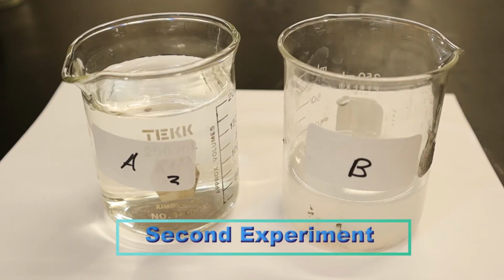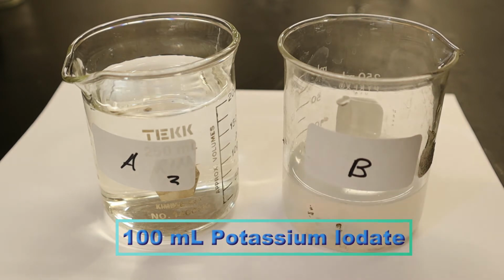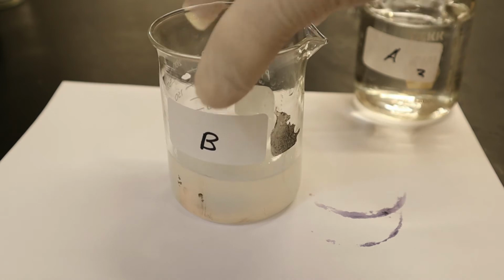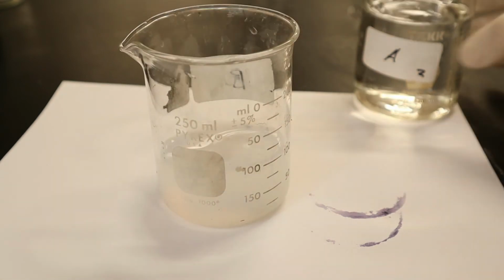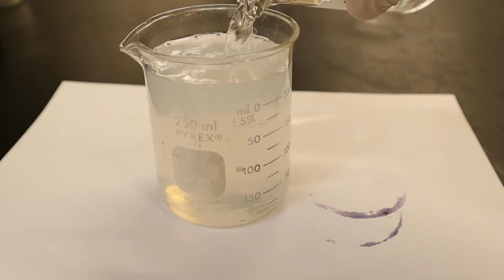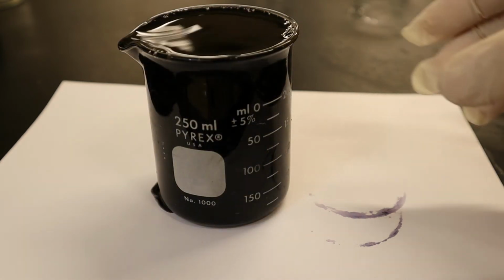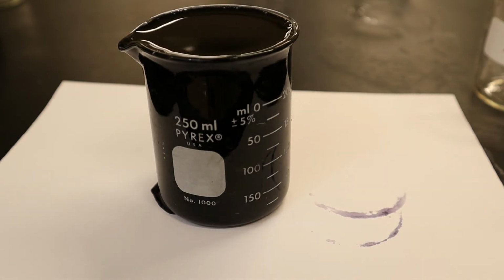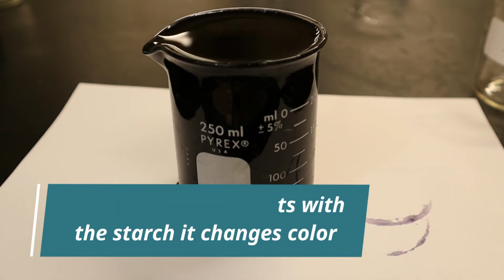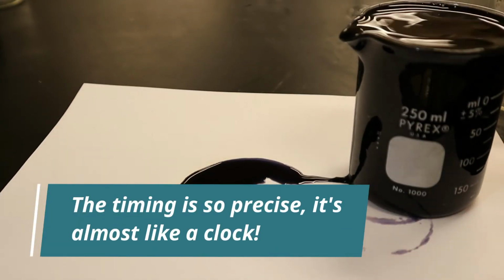All right. So now we're going to do the second solution. This solution has 100 milliliters of the potassium iodate. Now you know what to expect, so it won't be a big surprise, but you should time it. Starting now. Wow, that was fast. That was very fast. All right, you notice how it's kind of a deep purple color? If it gets on the paper, you can see that. It's almost like ink.